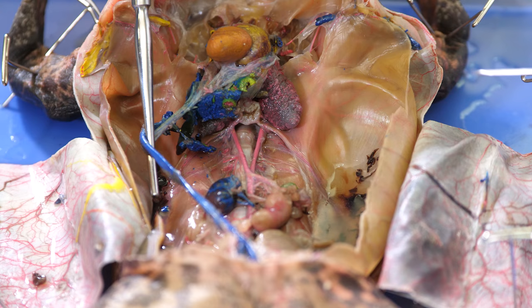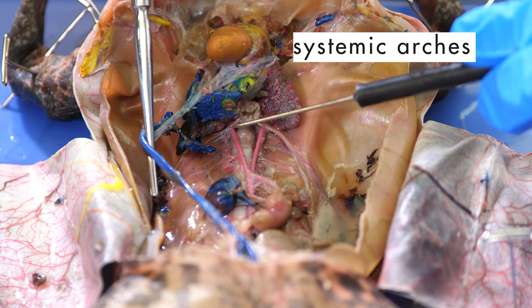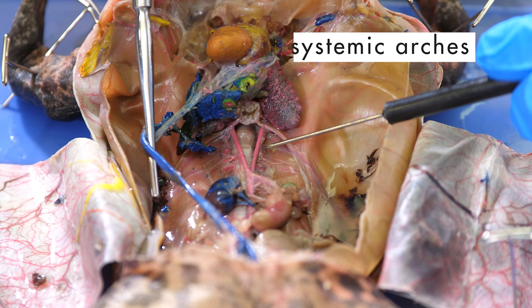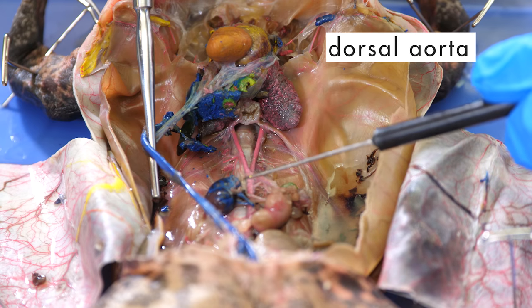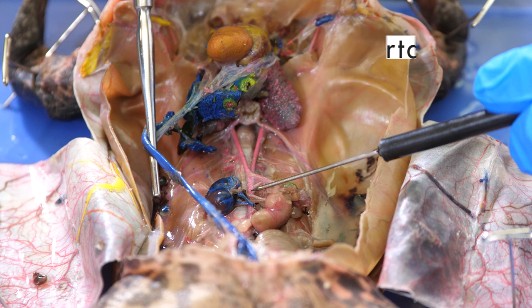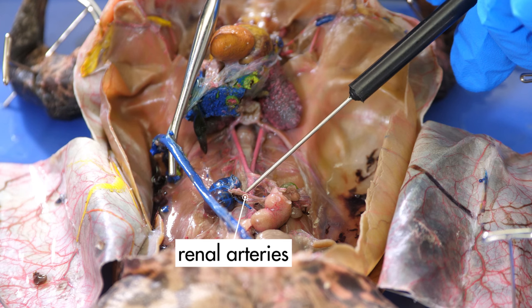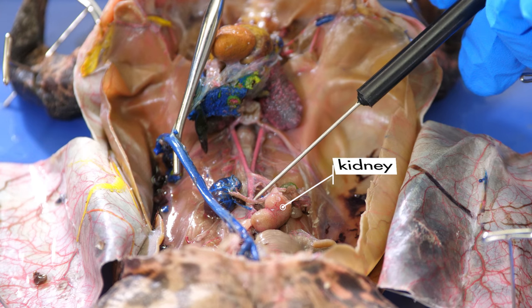The main artery that carries blood away from the heart is the aorta. The aorta splits into two systemic arches, here and here. Then, the arches rejoin in the lower abdomen to form the dorsal aorta. Several smaller arteries branch off the dorsal aorta. These are the renal arteries. Renal arteries carry blood to the kidneys, where liquid waste is filtered from the blood.